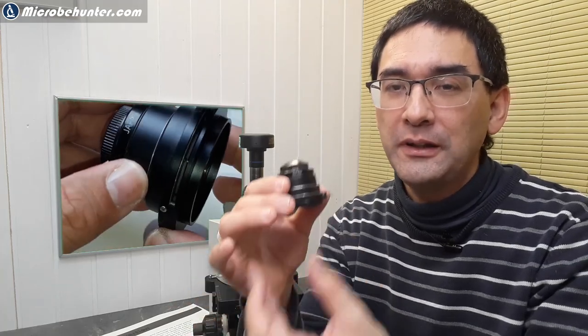Today in this video I would like to explain to you how to actually properly use the condenser, because I have a question which I would like to share with you.